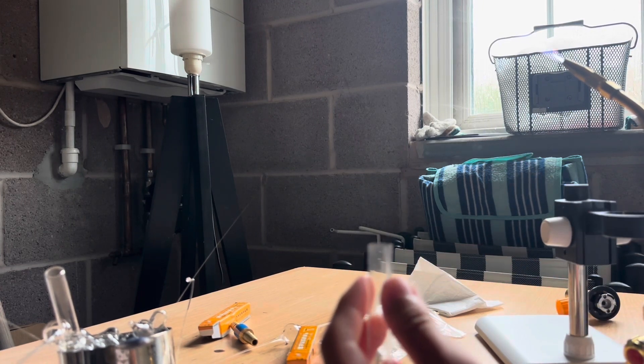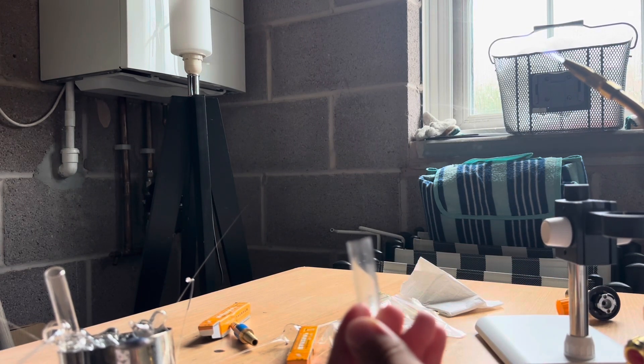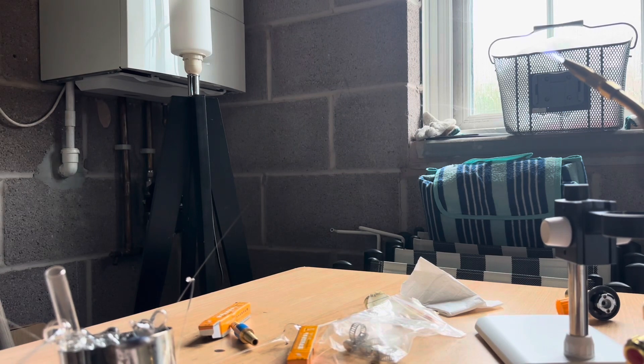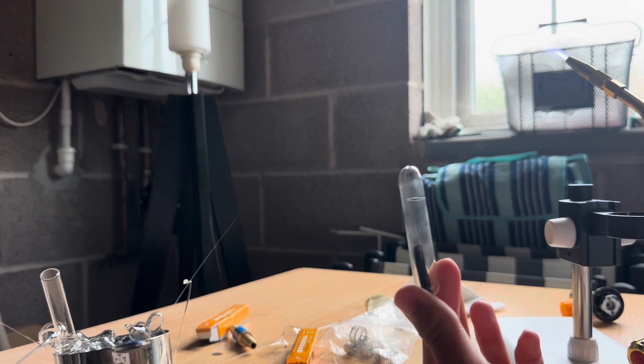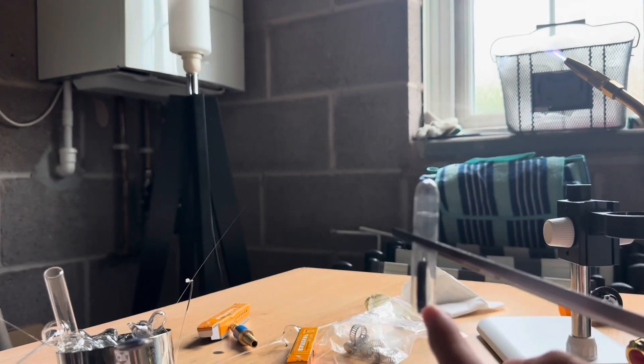The glass is slightly wobbling, but it's better than a most cracked glass.